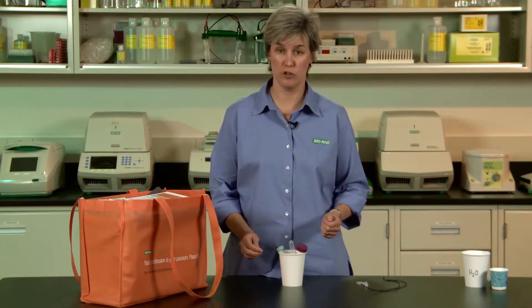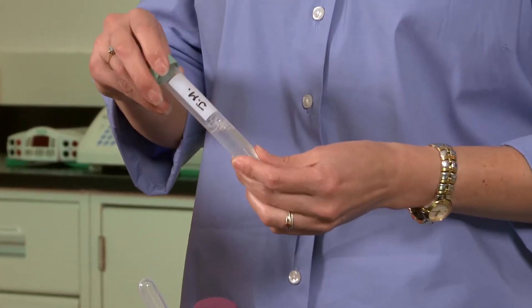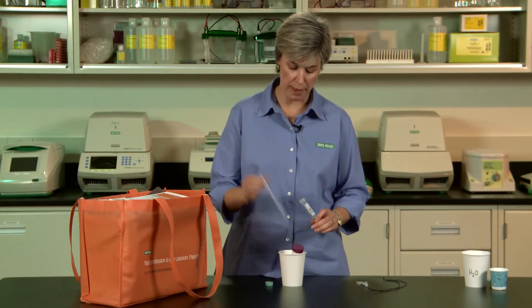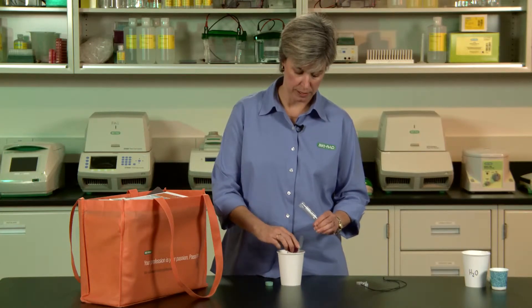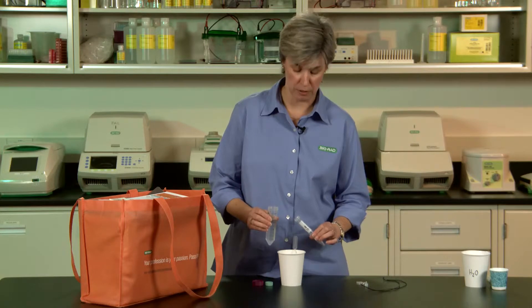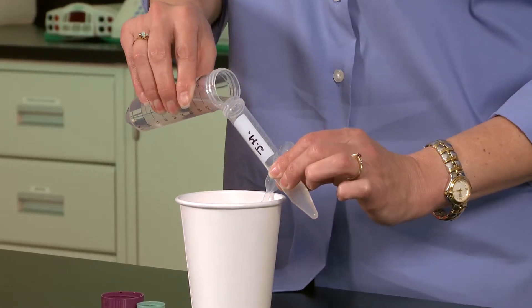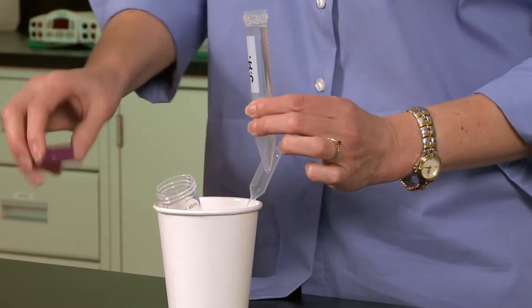After your students have collected their cheek cells, the next step is to precipitate the DNA. I want to show you a couple of tricks on adding your alcohol to the DNA. Students might want to take their tube and shake it up — you really want to discourage that. When you're adding the alcohol to these tubes, you can either have them pipette the alcohol using the transfer pipette in several additions, or you can simply pour the alcohol into the tube. Have the students hold their tube at about a 45-degree angle, then gently pour the alcohol in and fill it up until the tube hits about 14 ml. Having a few paper towels around will also help with a little bit of mess.